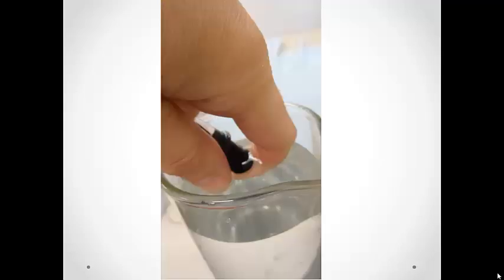Invert the gas measuring tube into your graduated cylinder filled with water.